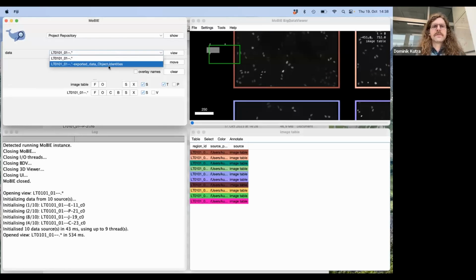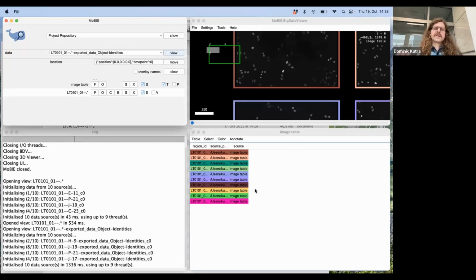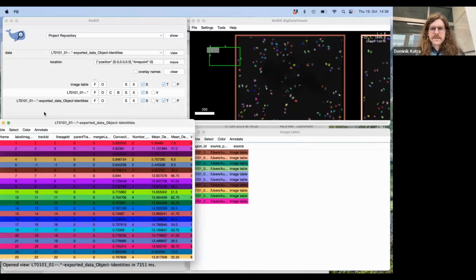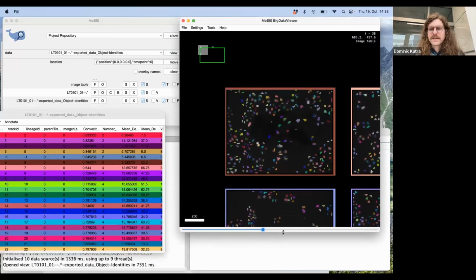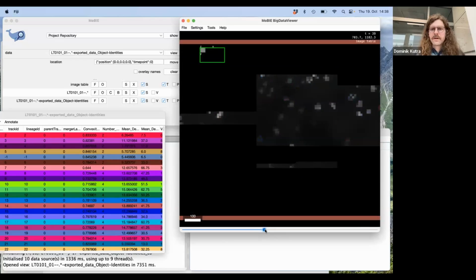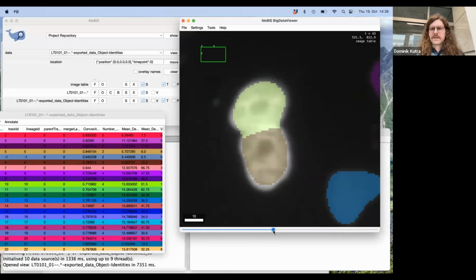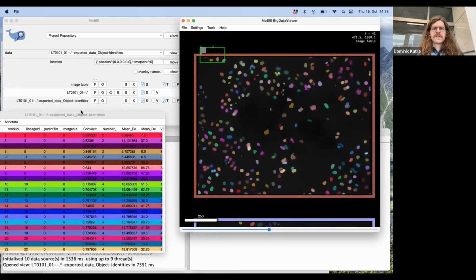And right away, we say that we want to also see the object identities. And this will take a little time, because this accesses both the images and the table. And the table has to be populated, so you can see it right here. Okay, I just want to make the view a little bit bigger. And as you can see, right now, if I scroll through time, the cells have different colors in every time frame. I hope you can appreciate this. So for example, if I go to these two here, it changes every time frame. So this is not what we want while we are looking at the tracking results.